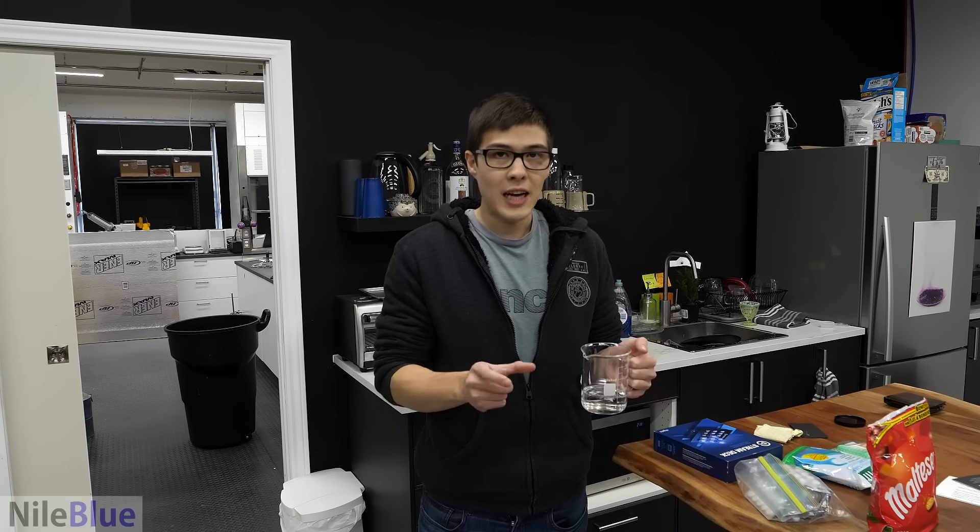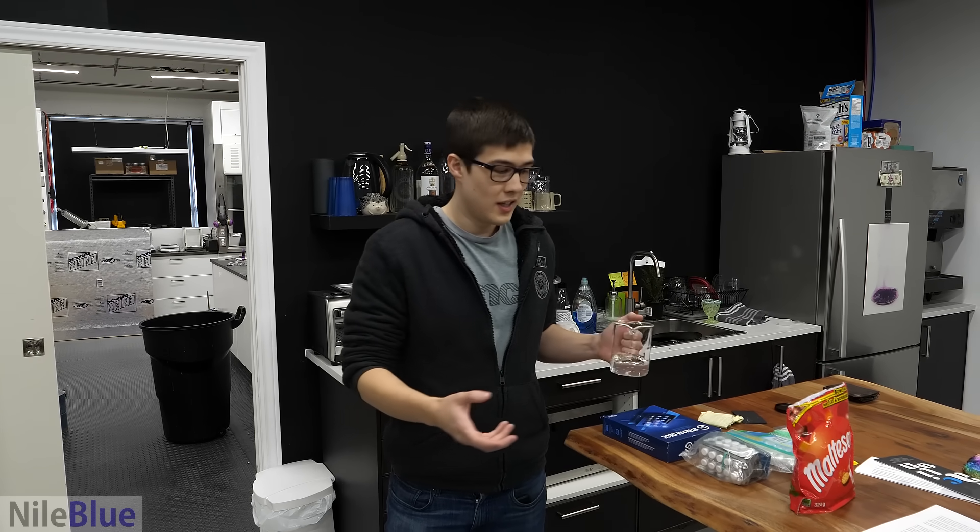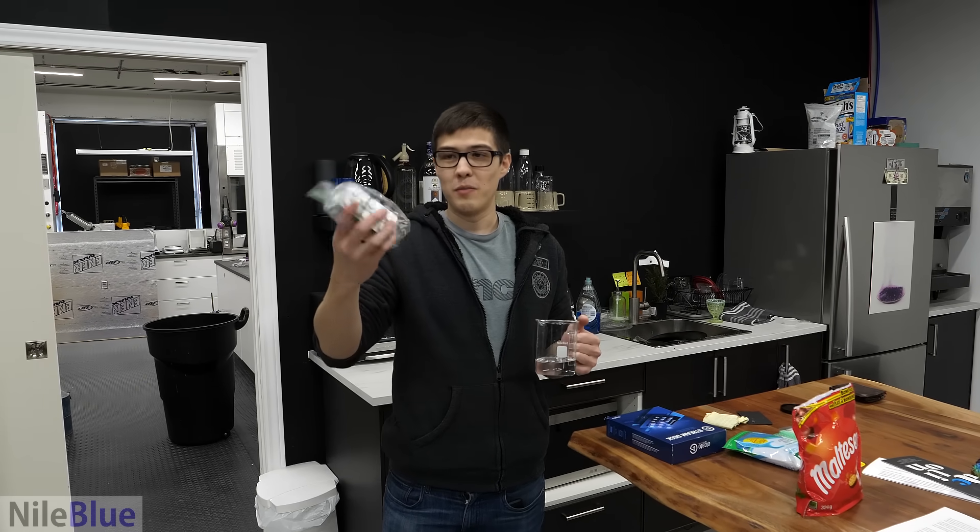This is often sold in stores as a calcium supplement, but the tablets that they sell are usually full of filler, which would probably interfere with the reaction. So I went online, and I was able to find some pure ones from Russia, and I bought a whole bunch of them.